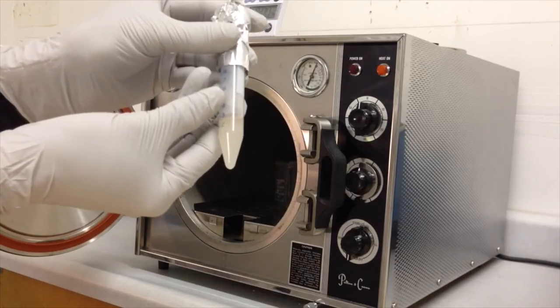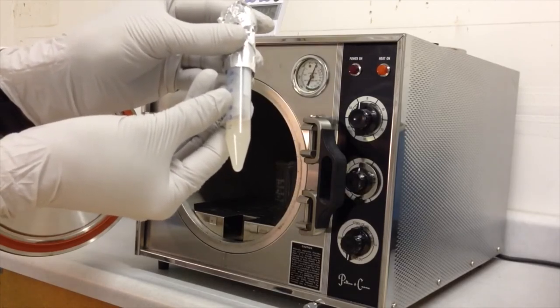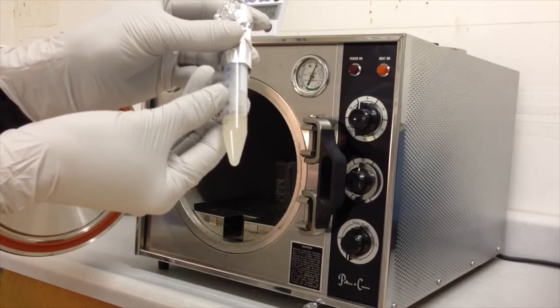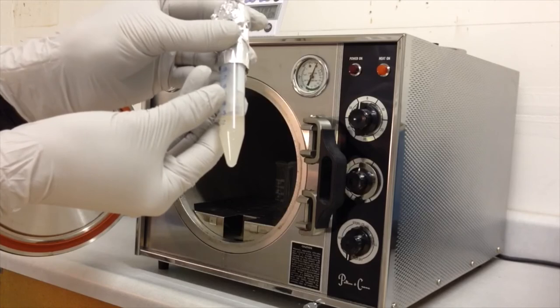Open the chamber door and remove the gel tube. As you can see, there is no discoloration of the gel. This experiment demonstrates how the silver containing gel can be made sterile without discoloration.